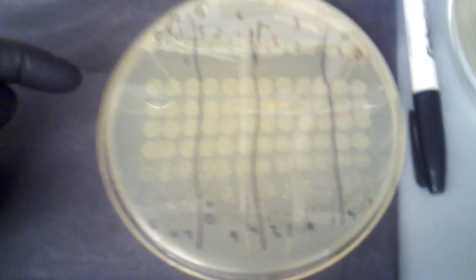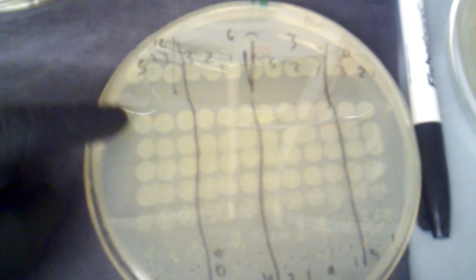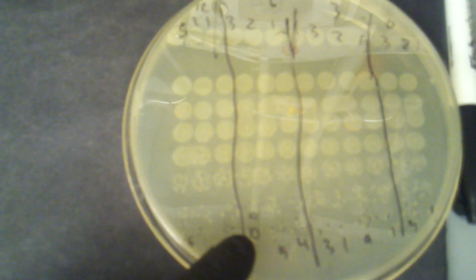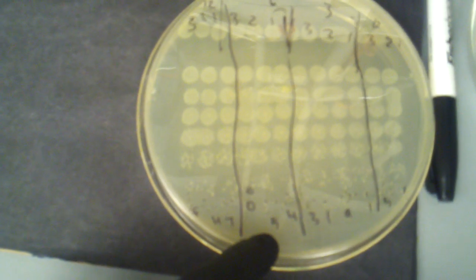And now if you look closely, you can see that from the top, as we go down, our colony fields become less and less dense until we eventually get to just a couple of colonies and then eventually 0 colonies. So what I've done is that I've just counted the countable colonies. So you can see here I have 5, 4, 7, this one's 0, and then 10 above it. Here's 5. Unfortunately the focus isn't that good here.